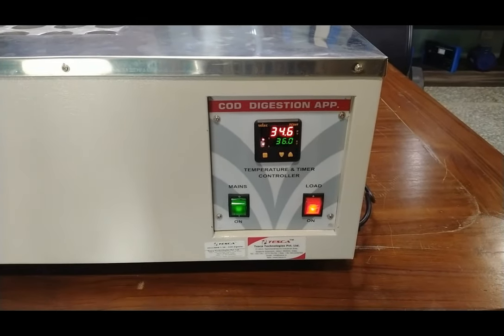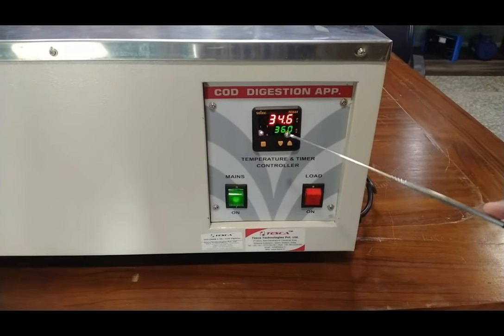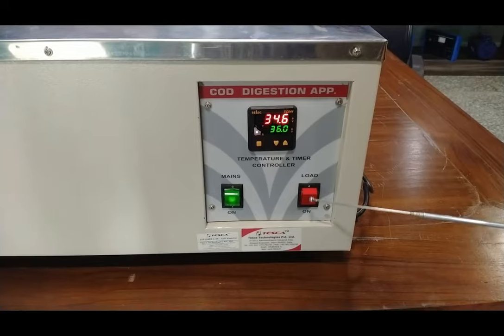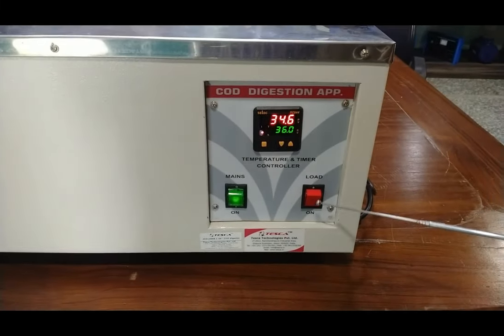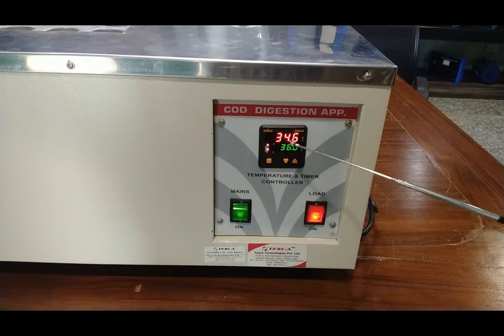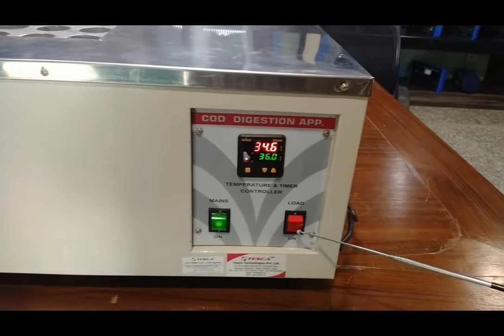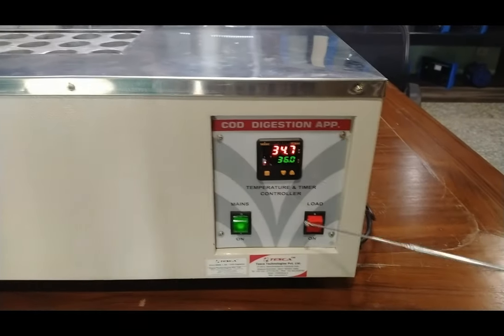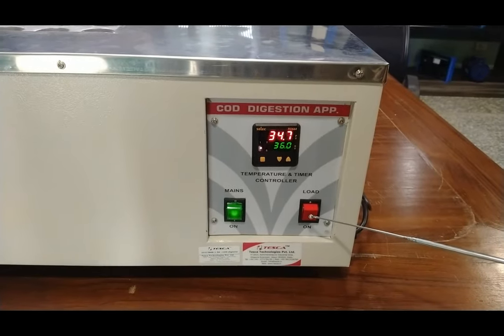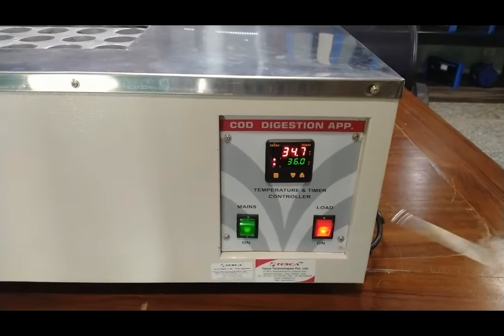The temperature is continuously increasing and when it reaches nearby 36 degrees Celsius, the blinking of the load switch will take more time between blinks. Right now the time gap is very less and it blinks very fast, but when it reaches nearby 36 degrees Celsius, the time gap of blinking will increase because it has to maintain the temperature at 36 degrees Celsius.